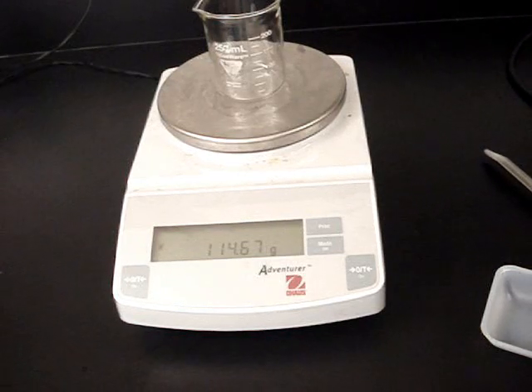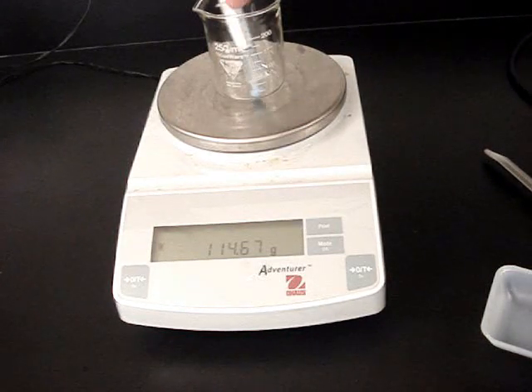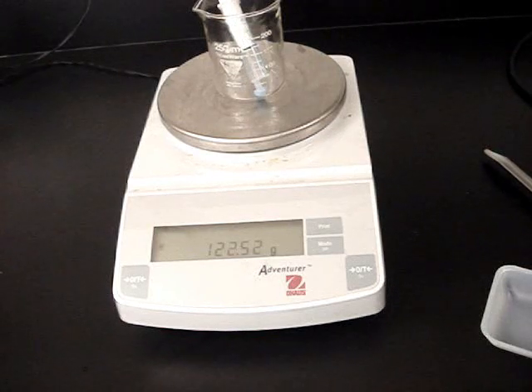If I then were to put an object in it, now I have the mass of the beaker and the substance that is in the beaker. I have both.